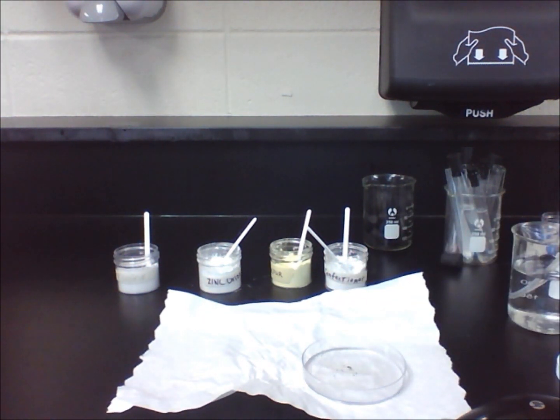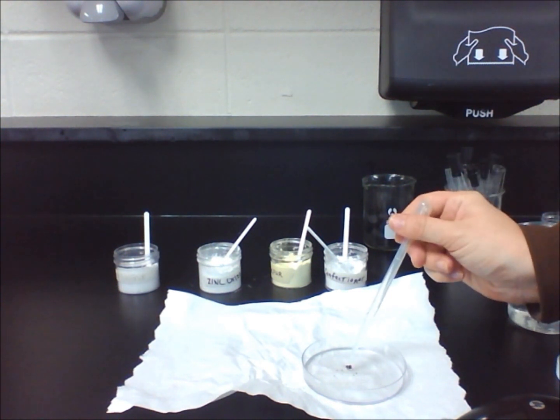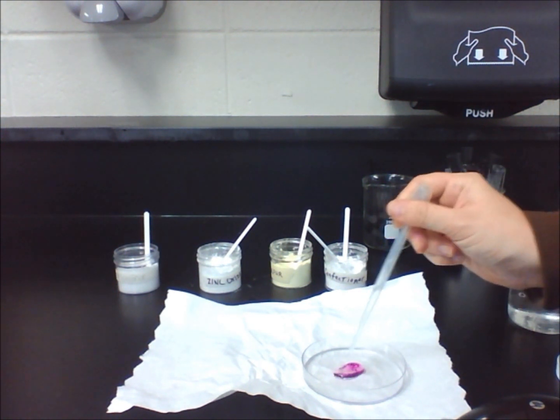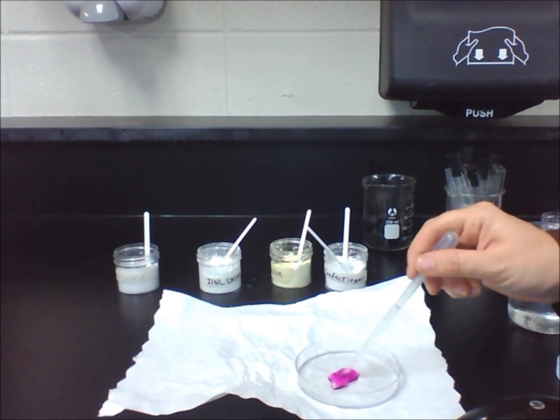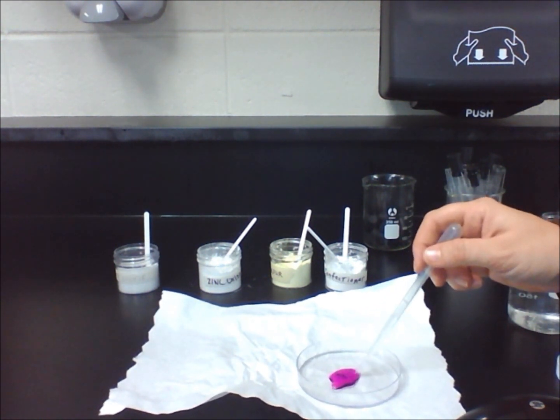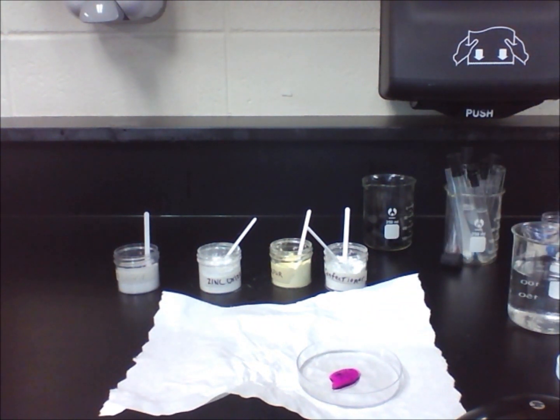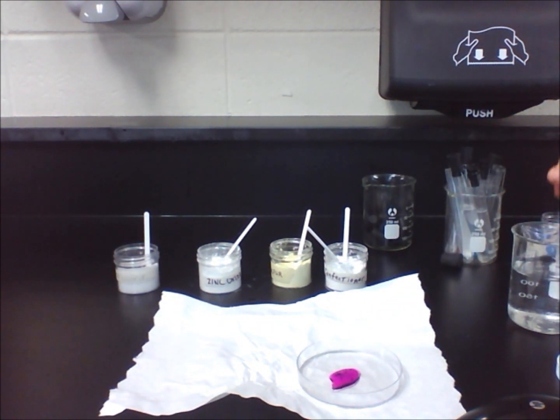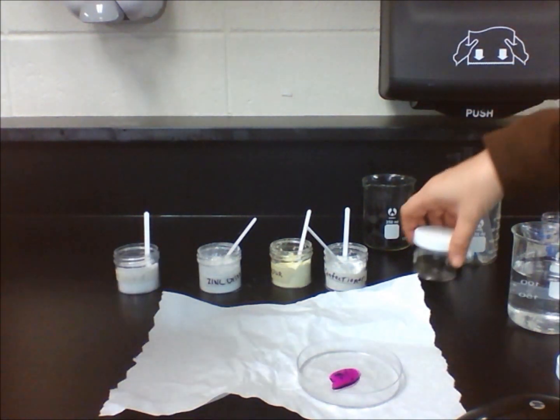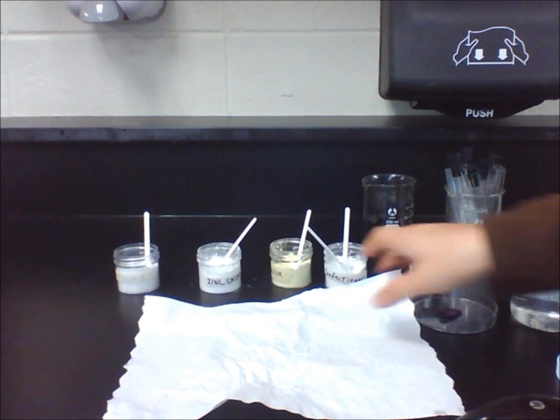Let's take a look at what happens when drops of water are added to two different substances. Place a couple of potassium permanganate crystals on a petri dish. Then using a pipette, slowly drop five to ten drops of water onto the substance. The water is turning into a purple solution because the solute dissolved in the water. Therefore, potassium permanganate is soluble in water.